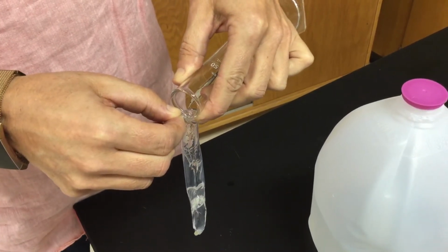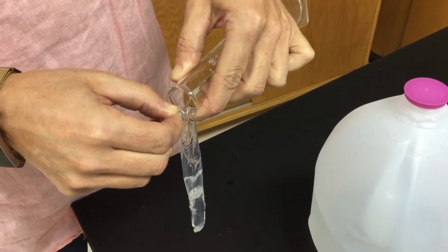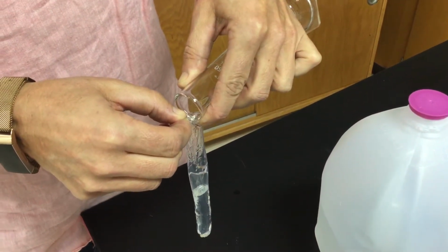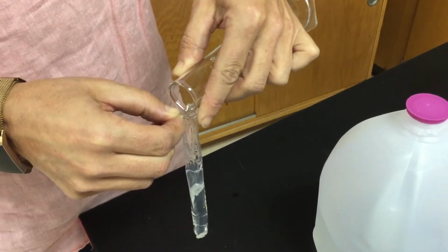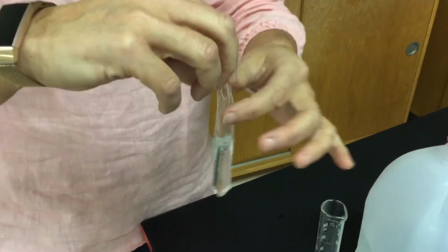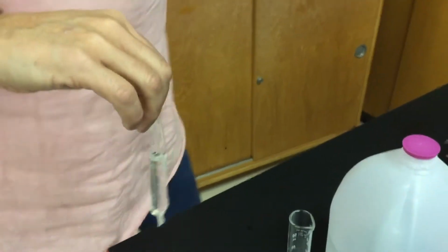And we're going to pour that 15 mLs in there slowly into my little baggie. And then I'm going to tie it off again. If you lose a little bit here and there, that's okay. We are going to weigh these anyway. So we'll have an initial mass, and then we're going to come back and weigh them next time as a final mass. You want to leave yourself a little room.